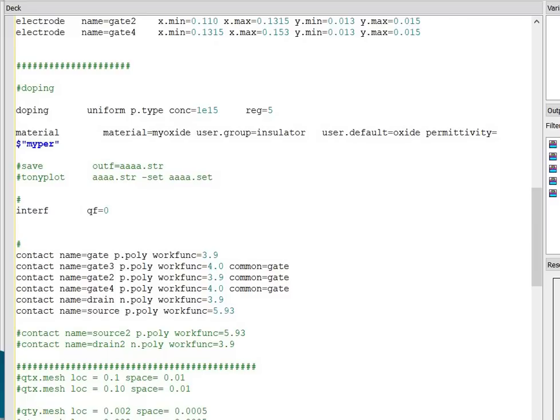Next I have defined the contact, drain side, gate side and source side. I am using two work functions. In the proposed device I have shown 3.9 and 4.5, but in this code I am using 3.9 and 4.0. This is the drain work function, 3.9, to induce charge carriers of approximately 5E18, and on the source side we are using the 5.93 work function to induce charge carriers of approximately 1E20.